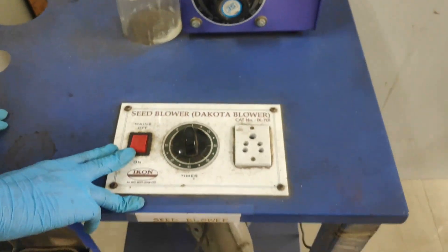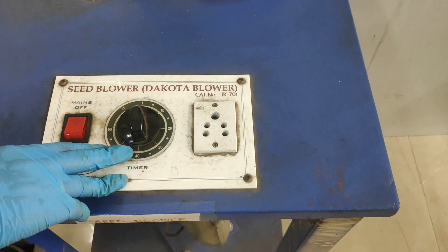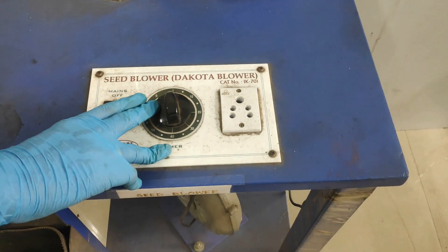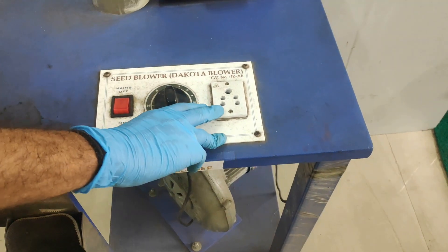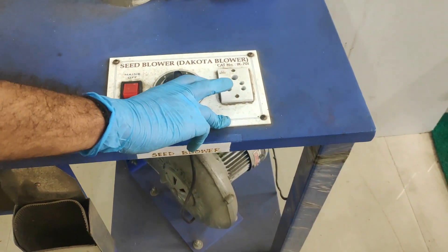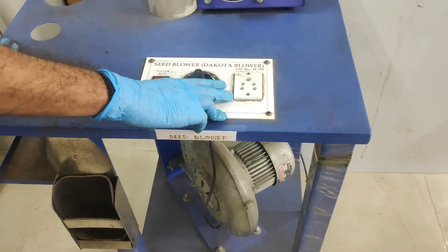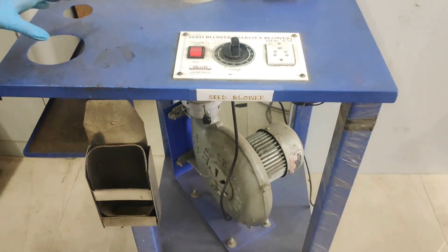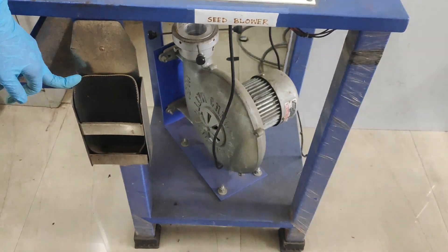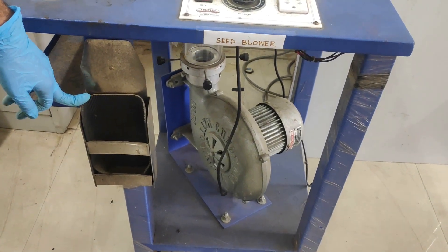The machine has a main switch, a timer switch to maintain the timer, and a socket in which we can insert the anemometer. The anemometer can be placed in the basket which is given on the left hand side of the machine.